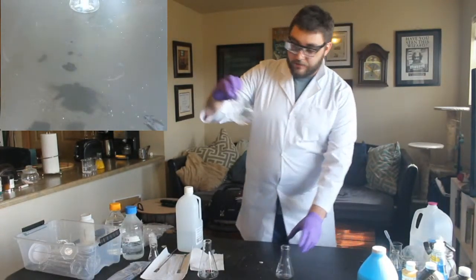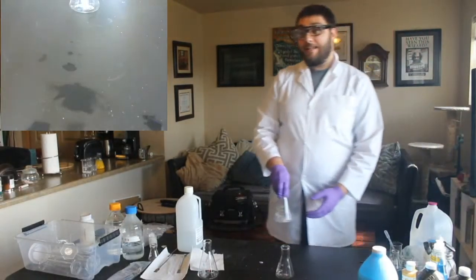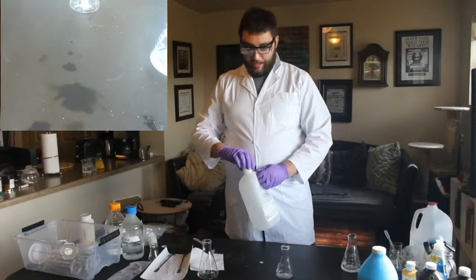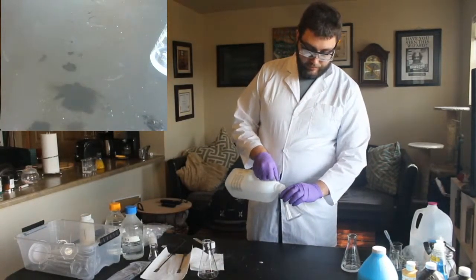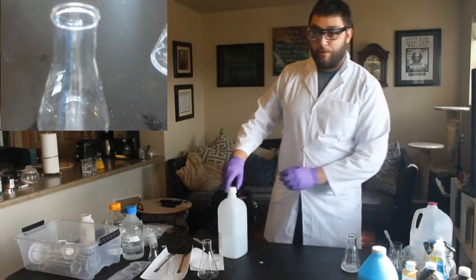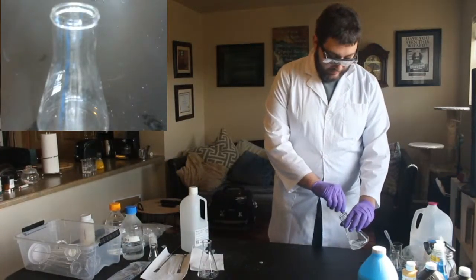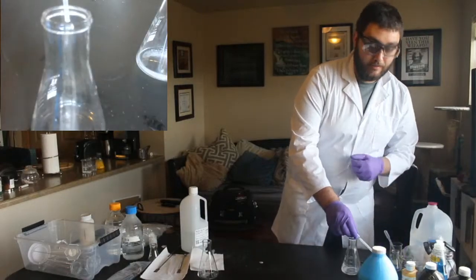So that's mostly dissolved, which is good, but we can't seem to get those last little bit of crystals, which means we can't dissolve any more in this water. So now we're going to take our hydrogen peroxide, and I'm going to do a mini test first. If we take this hydrogen peroxide and combine it with a little bit of our potassium iodide, watch what happens.